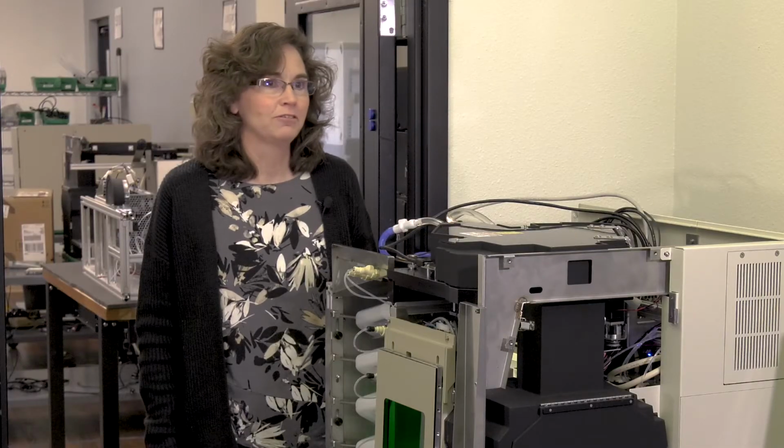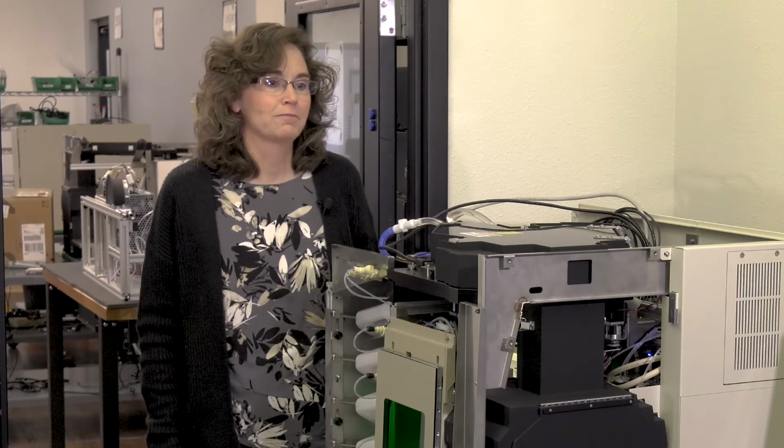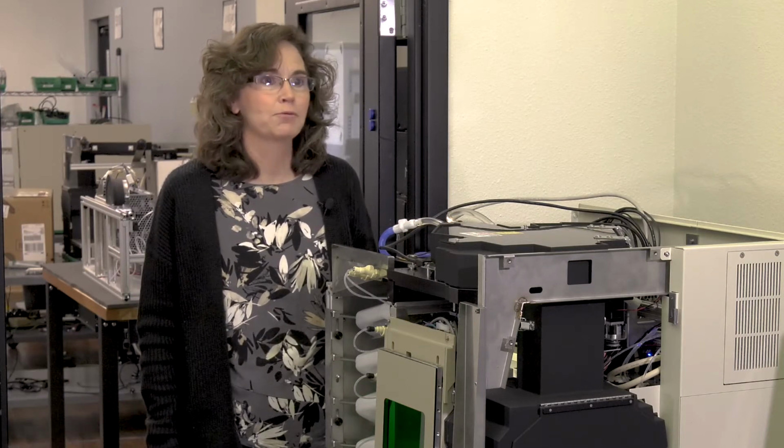So the main tough things for me from an optical perspective was it needed to have 5 lasers, 30 detectors, and be not really in any way motorized or automated. We call that fixed alignment, so that it is aligned once, and then day in, day out, the instrument just turns on and keeps working the same way.